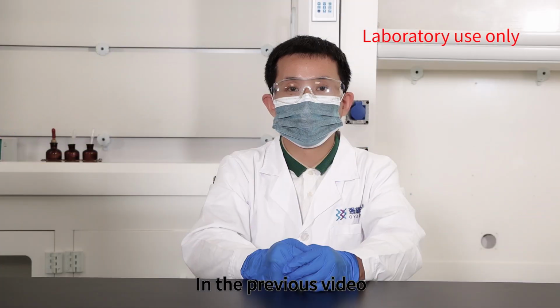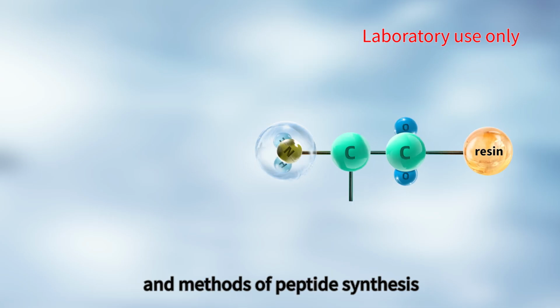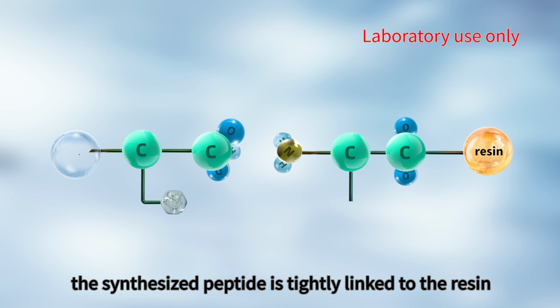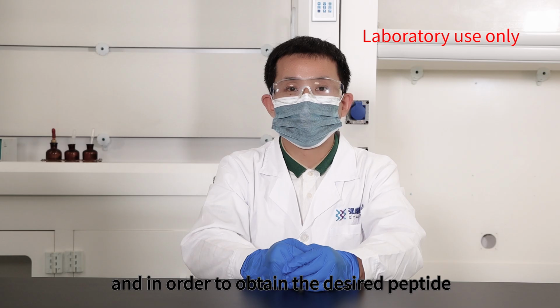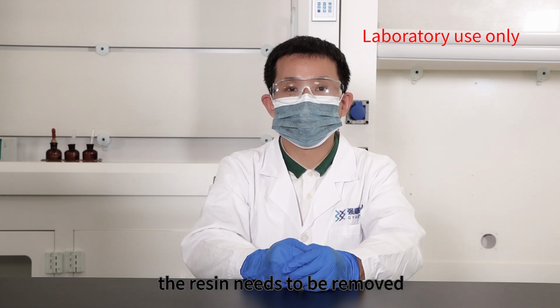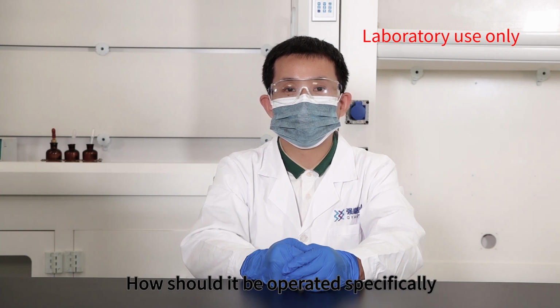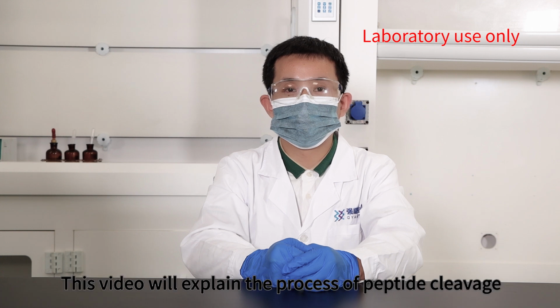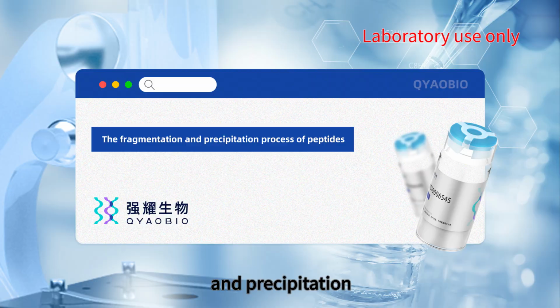In the previous video, we have learned about the principles and methods of peptide synthesis. However, the synthesized peptide is tightly linked to the resin, and in order to obtain the desired peptide, the resin needs to be removed. That is, the peptide needs to be cleaved off the resin. How should it be operated specifically? This video will explain the process of peptide cleavage and precipitation.